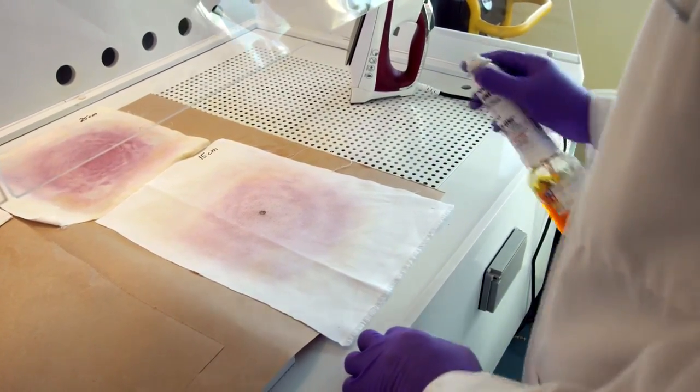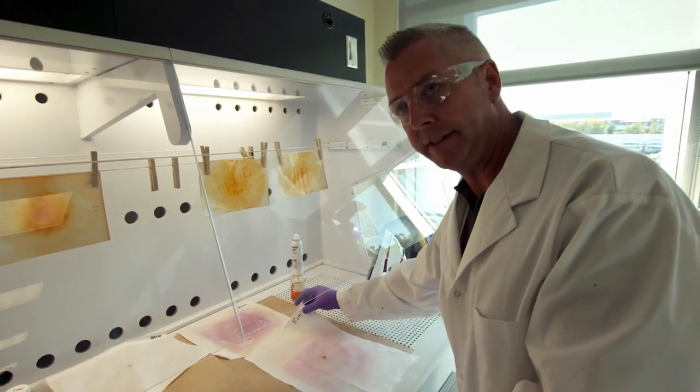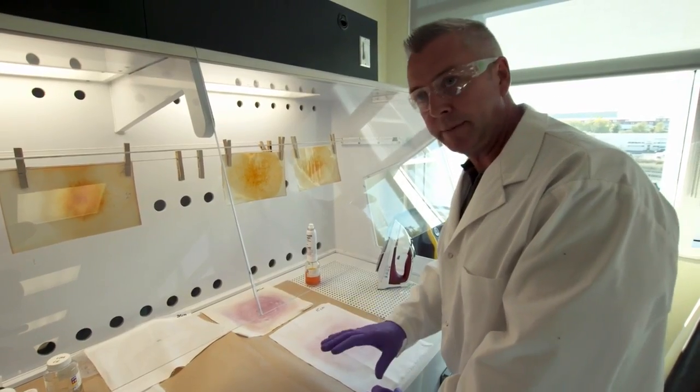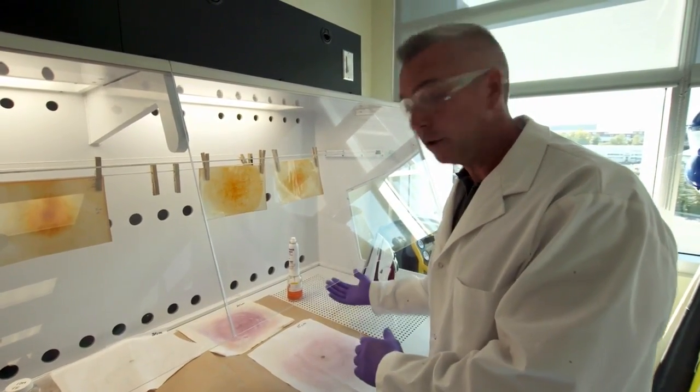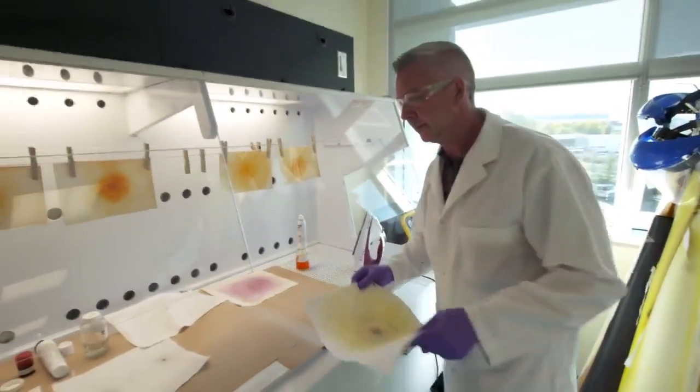There we go. The pattern of lead residue I see there is giving me a pattern to look at at a known distance of 15 centimetres. So when I compare this pattern to my evidence pattern, I'll know whether or not it's greater than or less than 15 centimetres. And I'll continue all my testing at different distances.